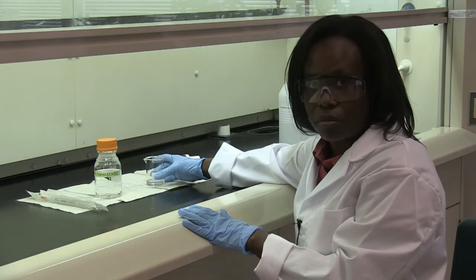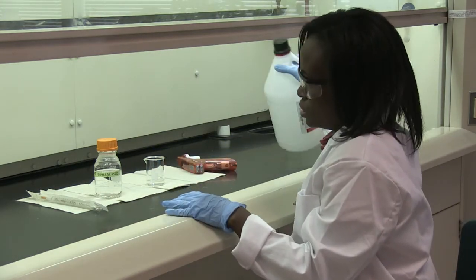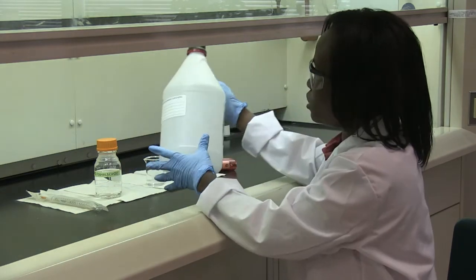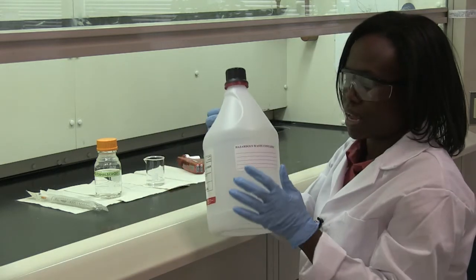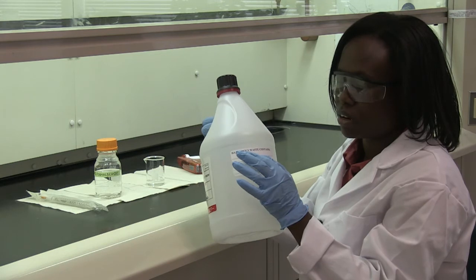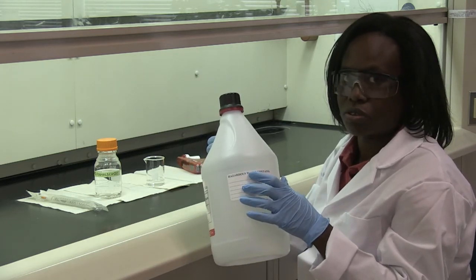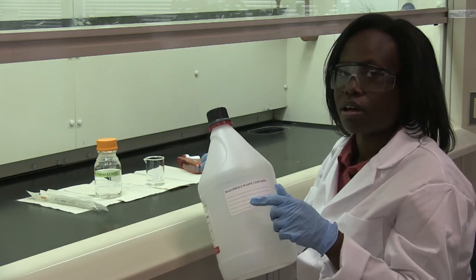When you have finished using your formaldehyde, you need to dispose of it — but this is one of those chemicals you do not pour down the sink. It is a carcinogenic agent, so you must put it in a waste container. Label the container with its contents — in this case, formaldehyde — so that the person responsible for disposal knows which container to use. Always put the correct waste in the correct waste container.